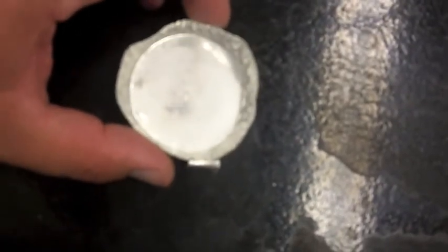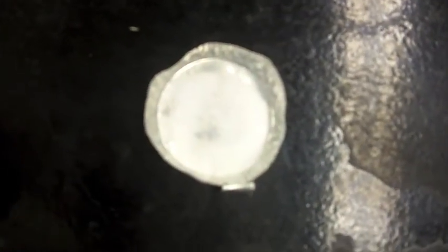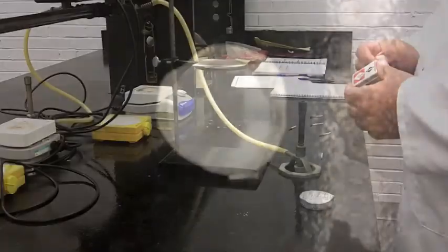You'll want to make sure that it's well spread out over the whole pan, so kind of jiggle a little bit. You don't want it all clumped at one end. You want to break up any of the small pieces to make sure those are broken up.